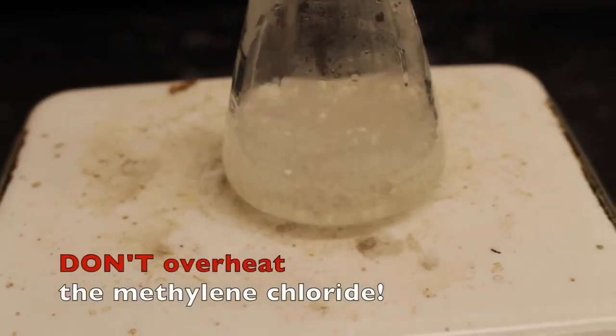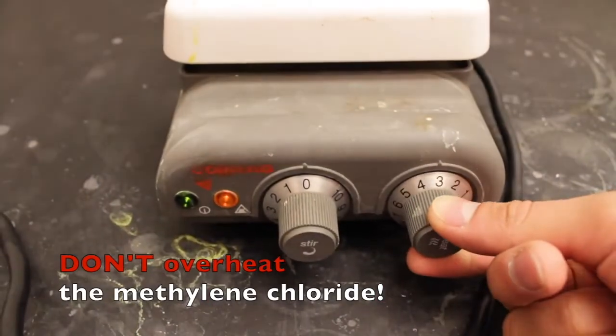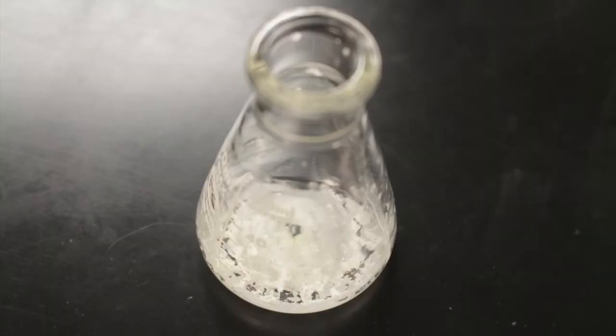Methylene chloride only has a 40 degrees Celsius boiling point, so if you see overboiling, reduce the heat. After removing the solvent, you should see the solid left on the bottom of the flask. This is the product. After the flask cools down to room temperature, weigh the flask with the product, calculate the percent recovery, and take an IR spectrum.